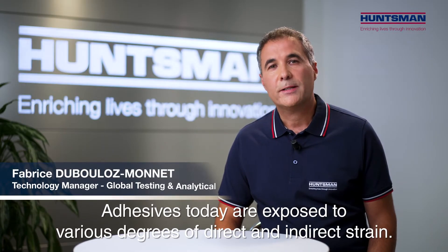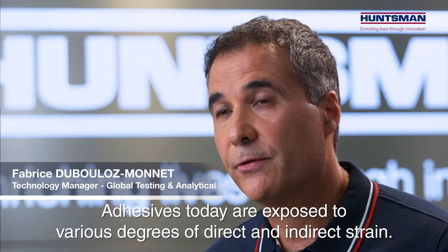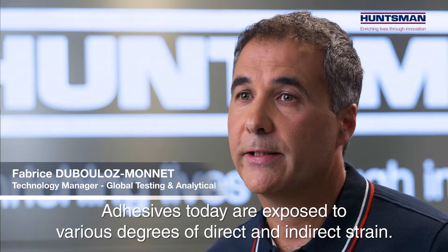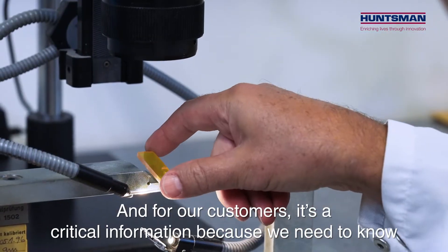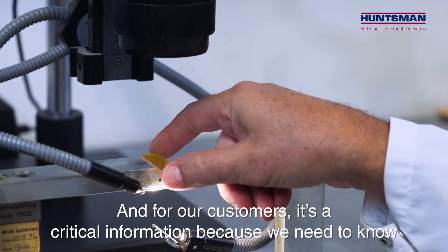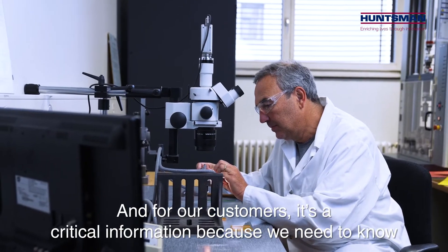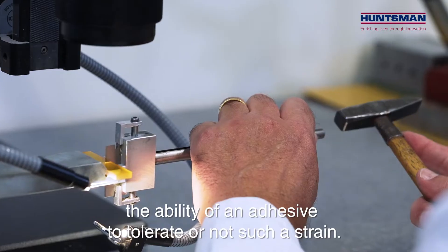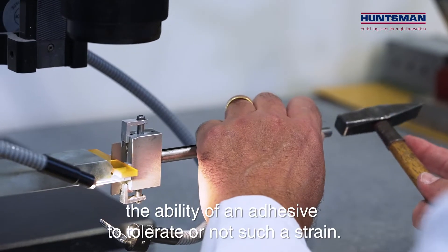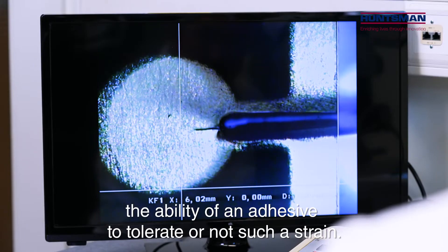Adhesives today are exposed to various degrees of direct and indirect strain, and for our customers it's critical information because we need to know the ability of adhesives to tolerate or not such a strain.